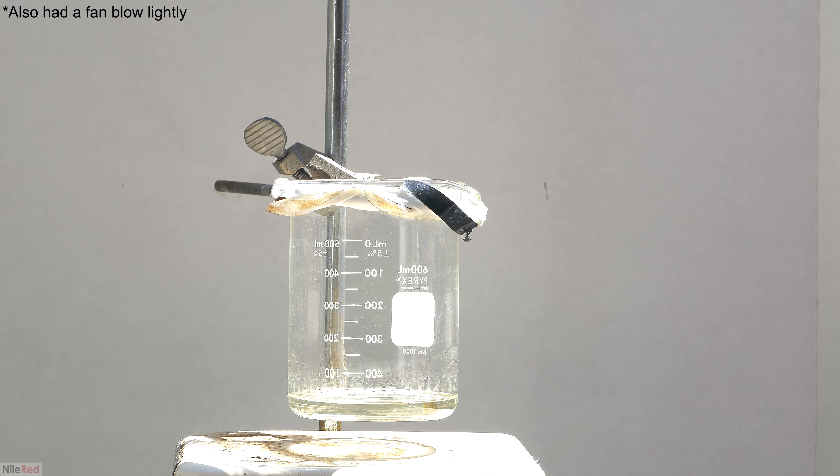What I did instead was turn on the hot plate and place the beaker something like an inch or an inch and a half away. What we want here is a nice steady rate of evaporation, but we also want to limit the heat, and we want to avoid getting things too hot.